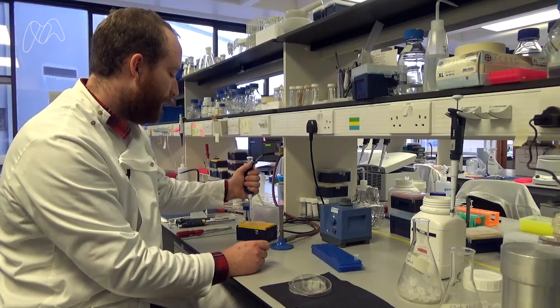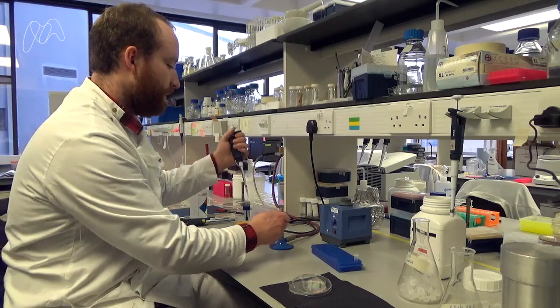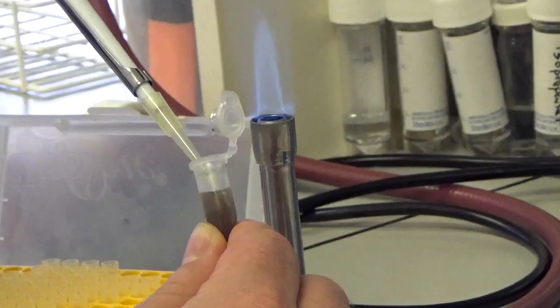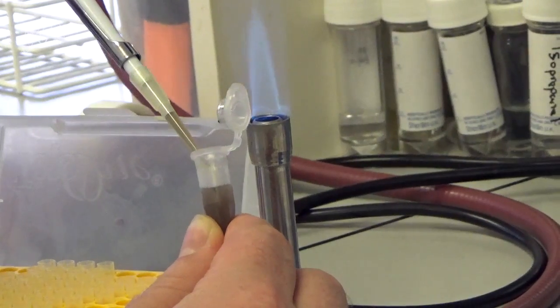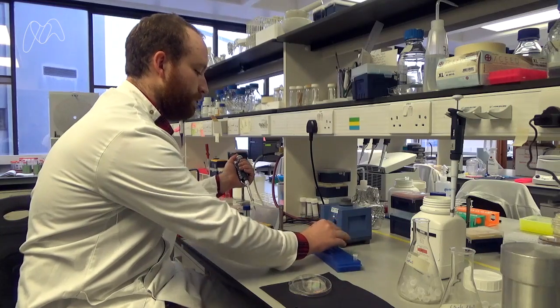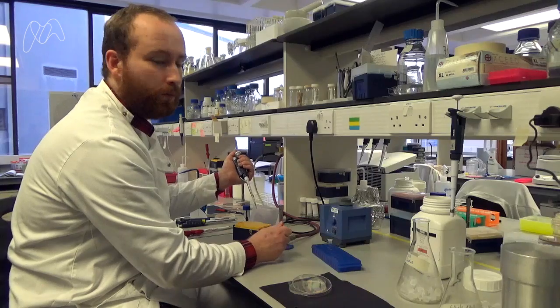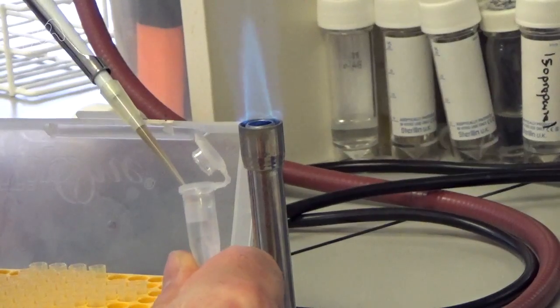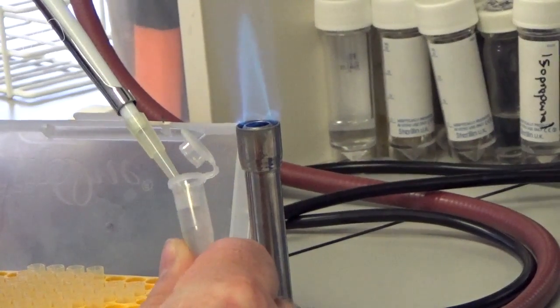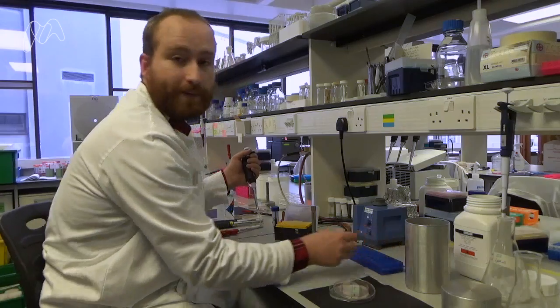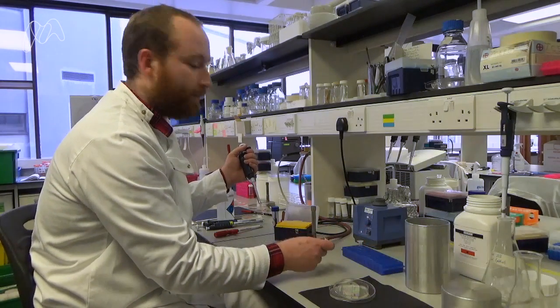So I take my pipette, and I take just a small quantity of the soil and water. And I add this to more water. So hopefully, now we've got only a manageable amount of bacteria in here.